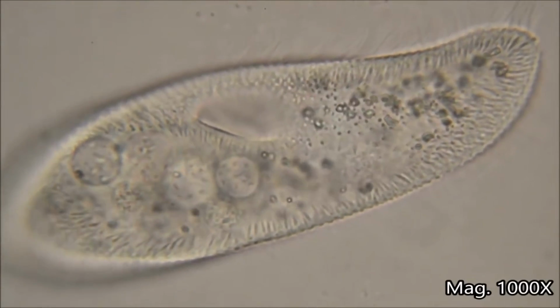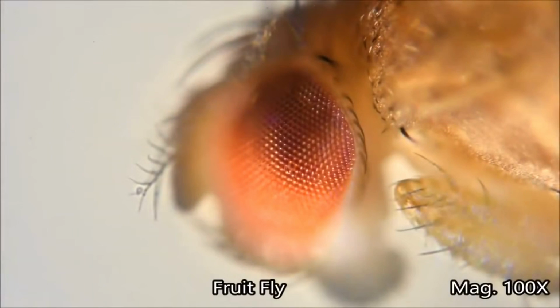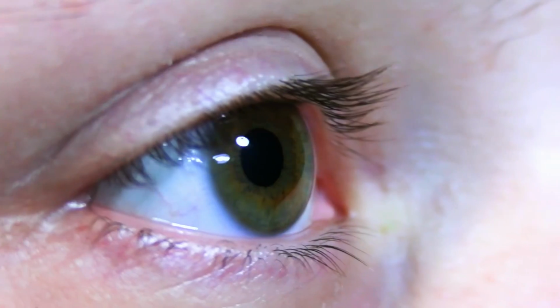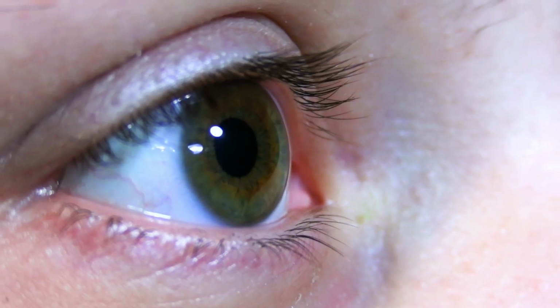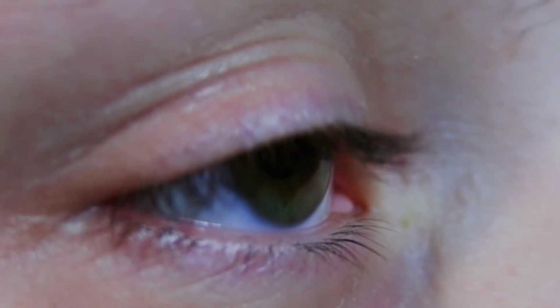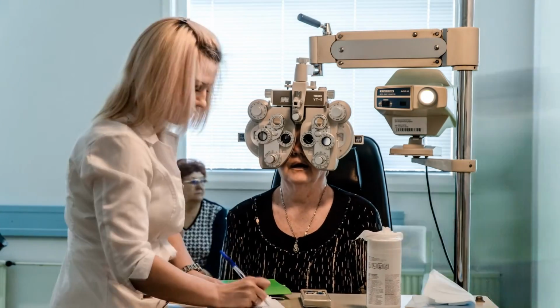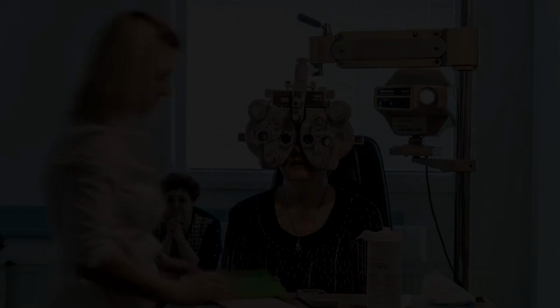We use the microscope to observe objects and elements which we cannot see with the naked eye. We have a limit of resolution we can see with our eyes. Even with specific vision, for example, short-sighted people can see smaller objects a little better than long-sighted people, but they're still limited.